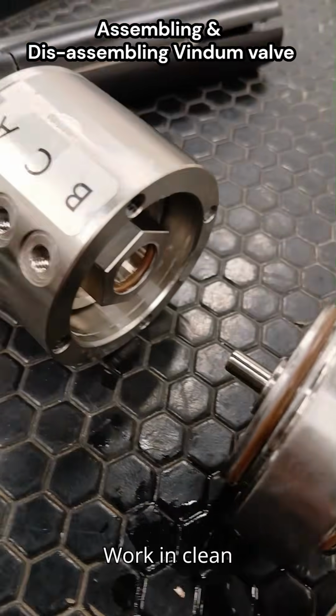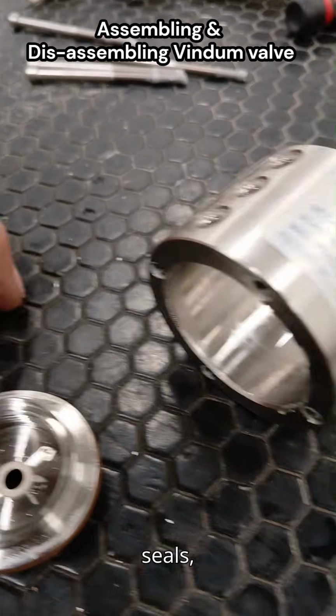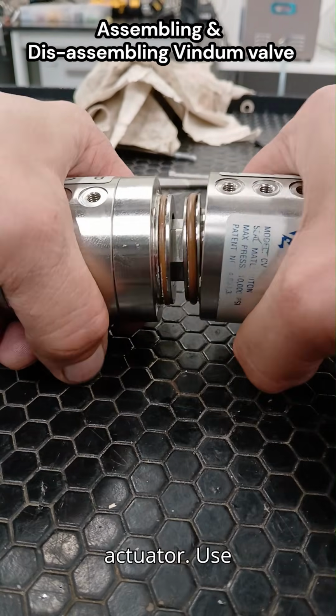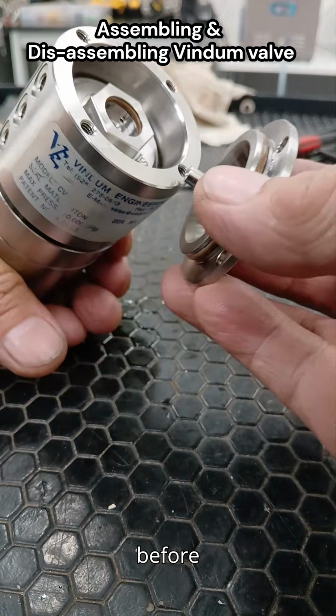Preparation. Work in a clean bench area, dust and grit can ruin seals. Have all parts laid out in order: body, rotor, seals, O-rings, bolts, handle, actuator. Use only manufacturer-approved lubricant on O-rings and sealing surfaces. Confirm port numbering orientation before starting.